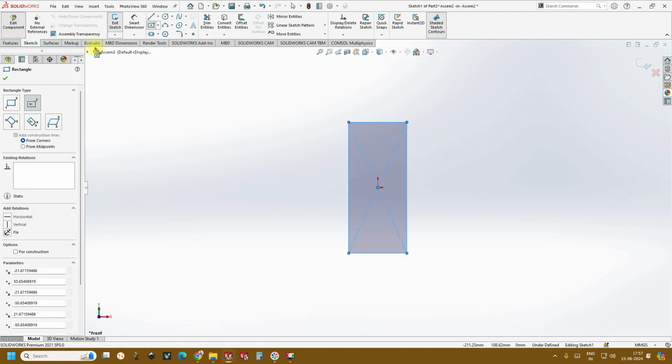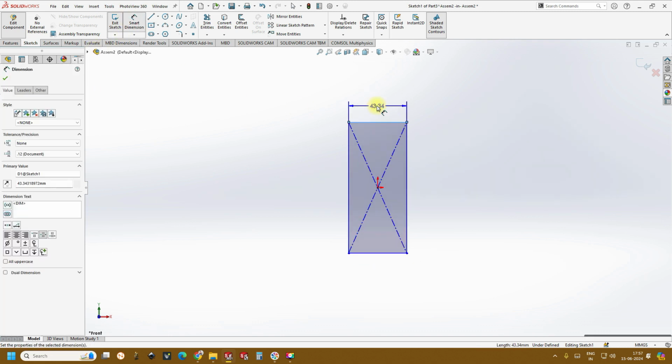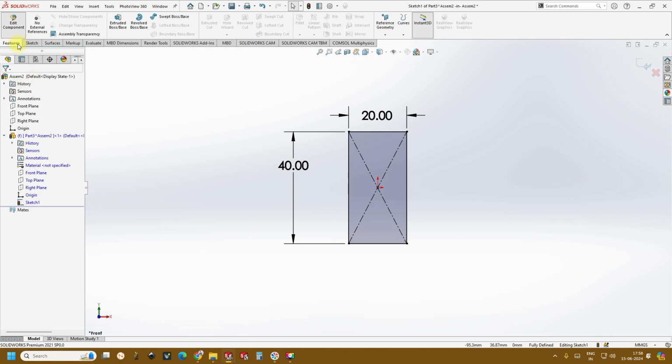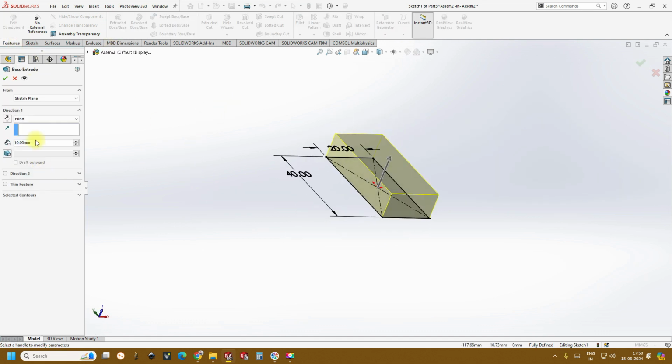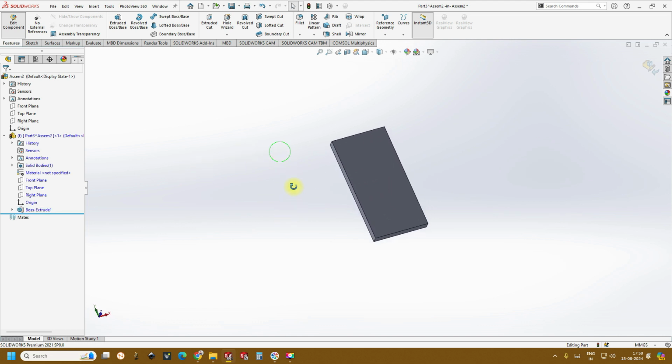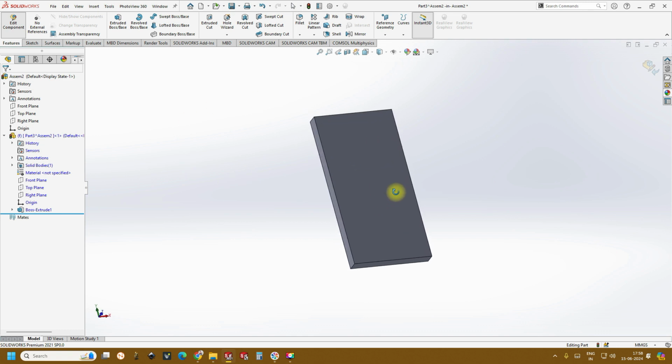So let's draw a rectangle. I prefer dimensions 20 cross 40. However, it can be changed according to your desired requirements. Go back to features, extrude this. So what we are doing completely is a 3D printable device. However, the 2D design remains the same for conventional photolithography based designs. Only thing, you will not be extruding the part. All the remaining channels and the channel tools that we are using can be used for both conventional lithography based as well as for 3D printing.